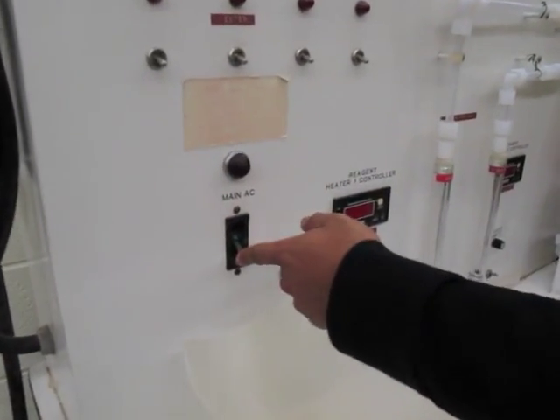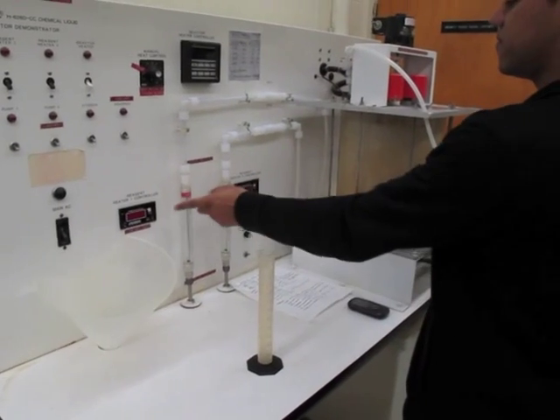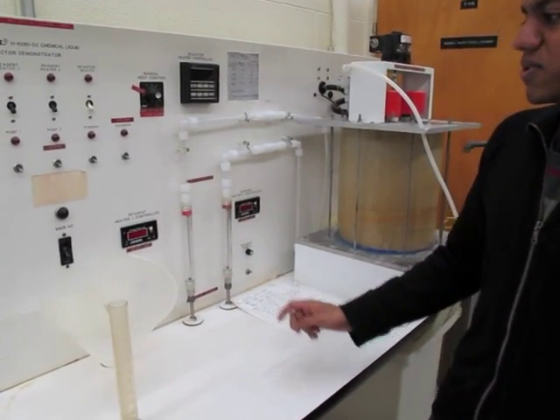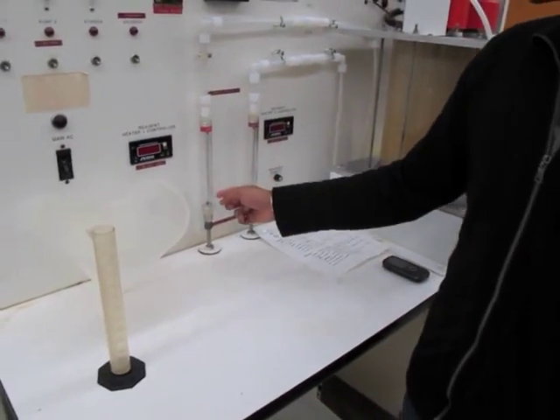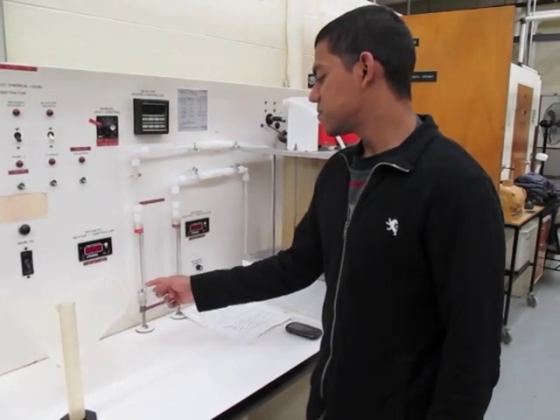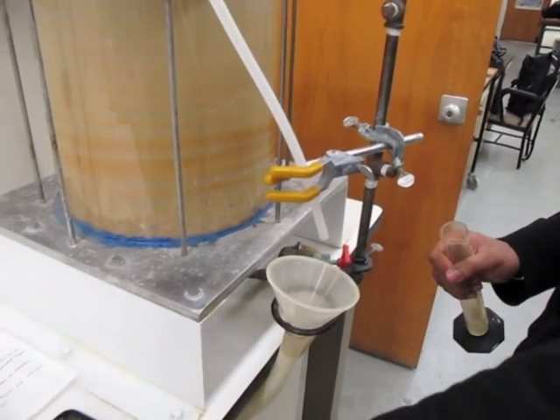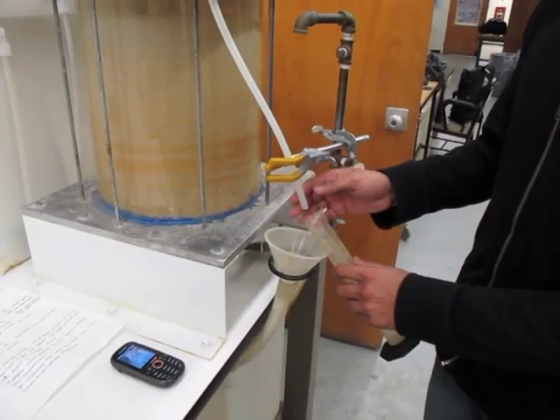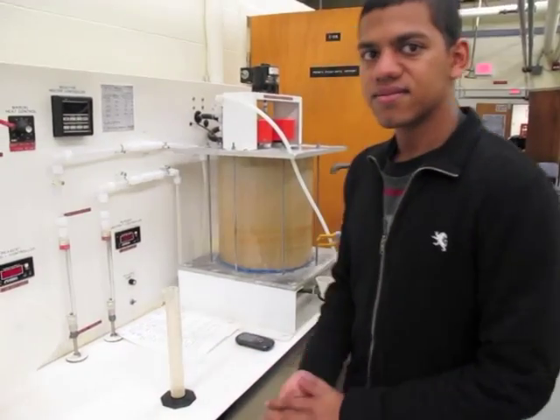The main power switch is right here, and here are the two power switches for the pumps. When you're doing calibration, you want to do one pump at a time. So you have the NaOH pump and the ester pump. First, we're going to work with the NaOH pump. You turn on only pump one, and then you set using this knob right here to the percent flow that you want to test. You want to range from 10% to 50%, but you don't want to go above 50%. The first point is 10%, and you would have the water flow through. Here is where the water is exiting out. You would use your stopwatch and set to about 90 seconds. You take three samples of water for each 90 seconds, and then you record the volume of water that came out to get the volumetric flow rate.